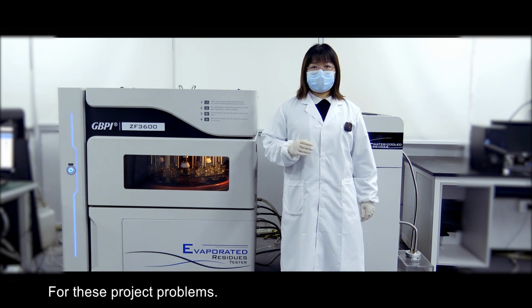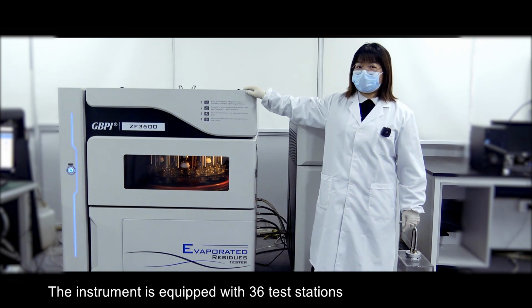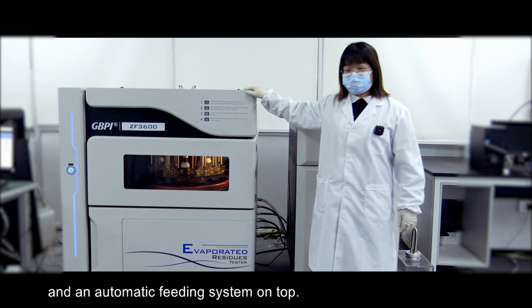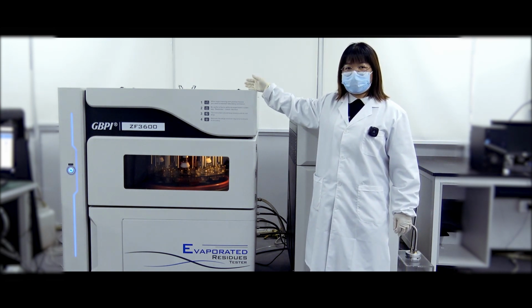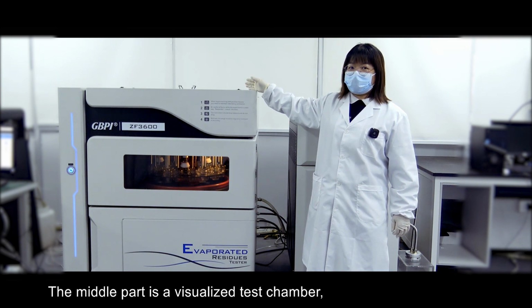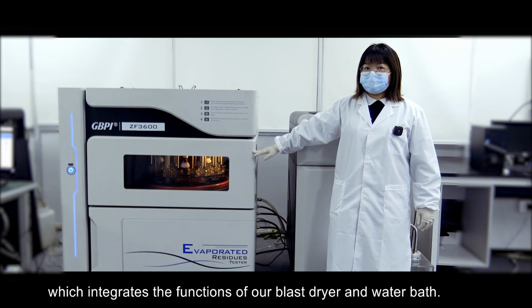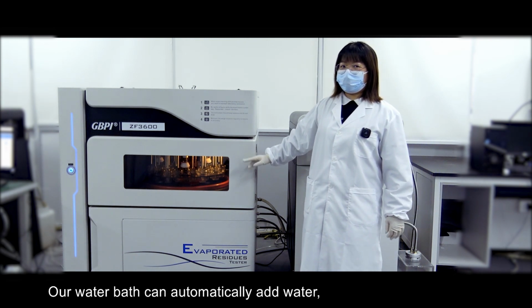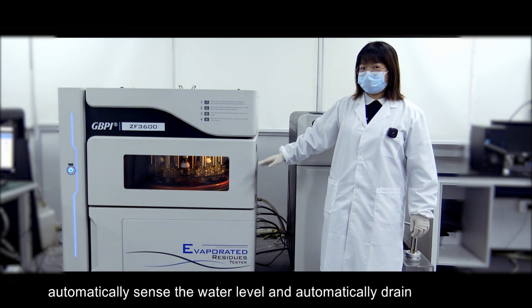For these problems, the instrument is equipped with 36 test stations and an automatic feeding system on top. Testing without waiting. The middle part is a visualized test chamber, which integrates the functions of our blast dryer and water bath. Our water bath can automatically add water, automatically sense the water level, and automatically drain.